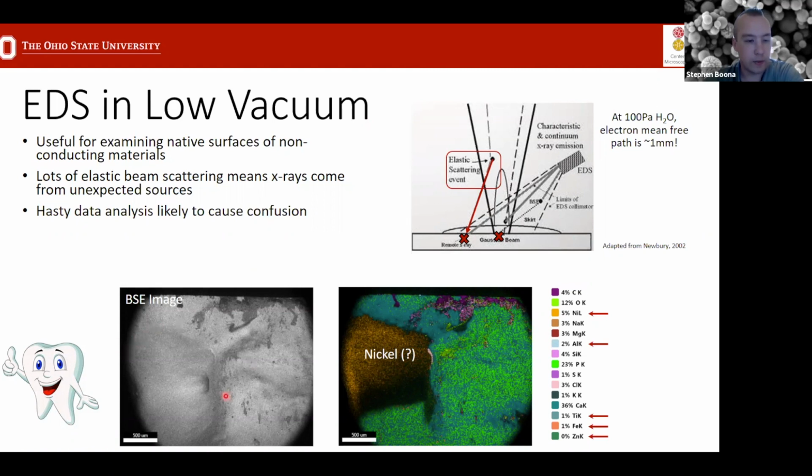So in this case, this is a bite surface. We know there's some topography here. And when you just look at this overlay of all the different elements identified automatically in the spectrum, these are real peaks. So there is really a peak for nickel and aluminum and titanium and iron and zinc. If you don't know better, you might think, oh, that's just a weird crown or something that's on the tooth, even though you might expect there to be some difference in the backscatter image. But this whole area seems as though it contains predominantly nickel. Until you think more carefully about what's happening inside the microscope, you realize that what's probably happening is this process, and you're seeing X-rays generated by the stage, not actually by the sample. So you have to be a little bit careful if you're doing EDS analysis. Even qualitative analysis in low vacuum can cause some issues like this to come up.